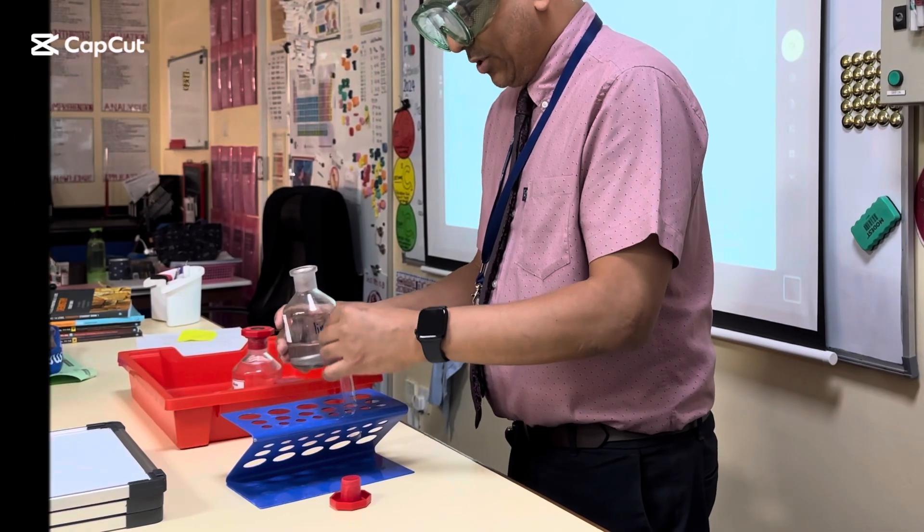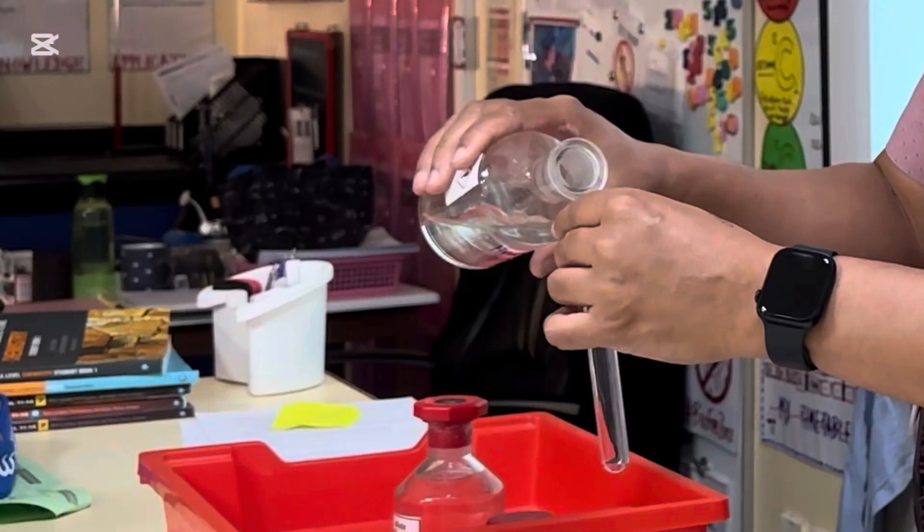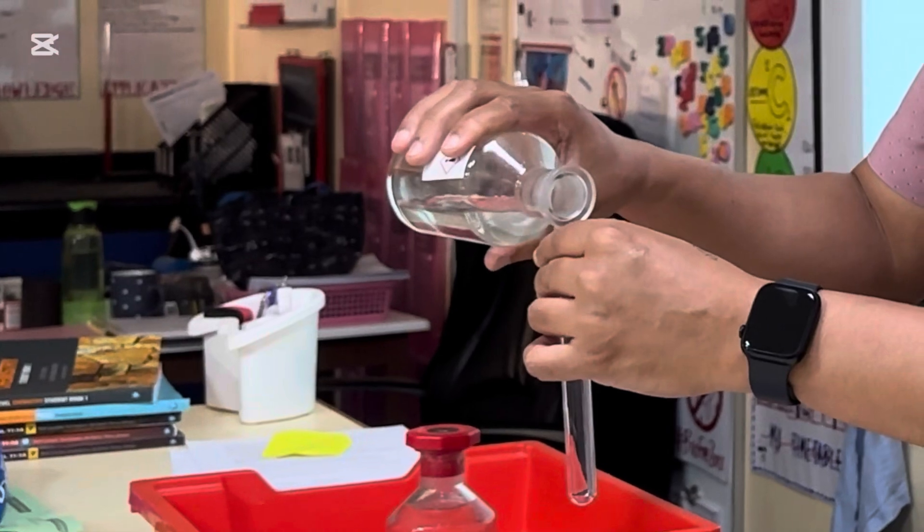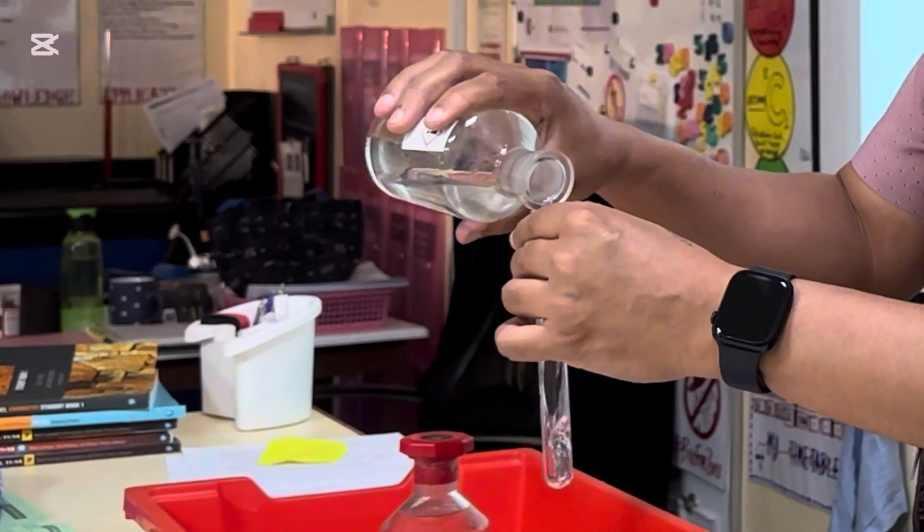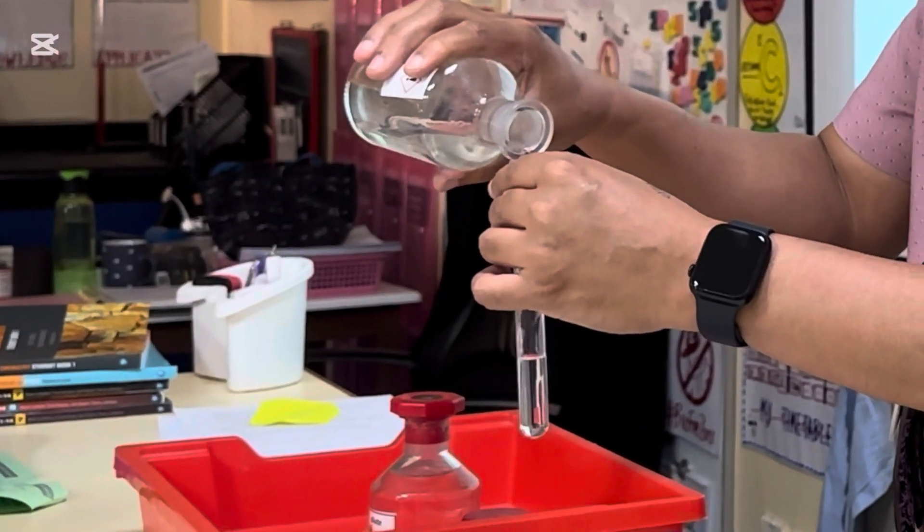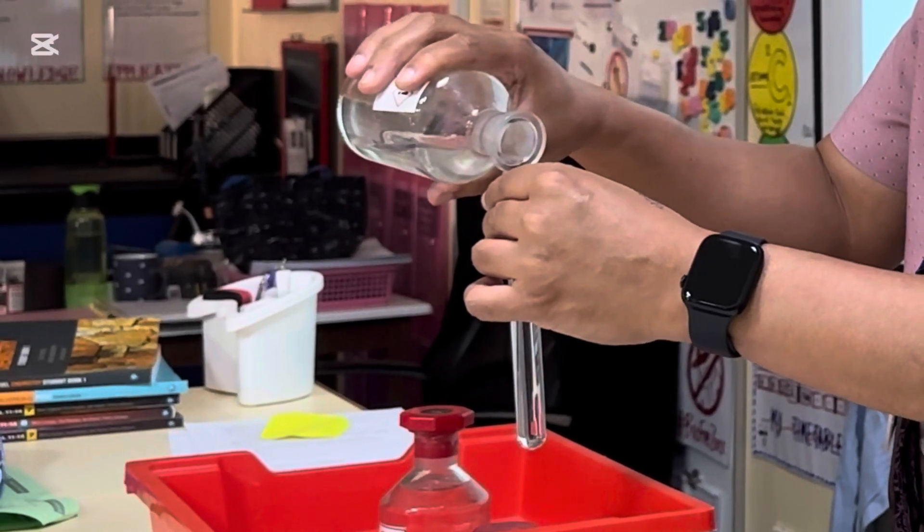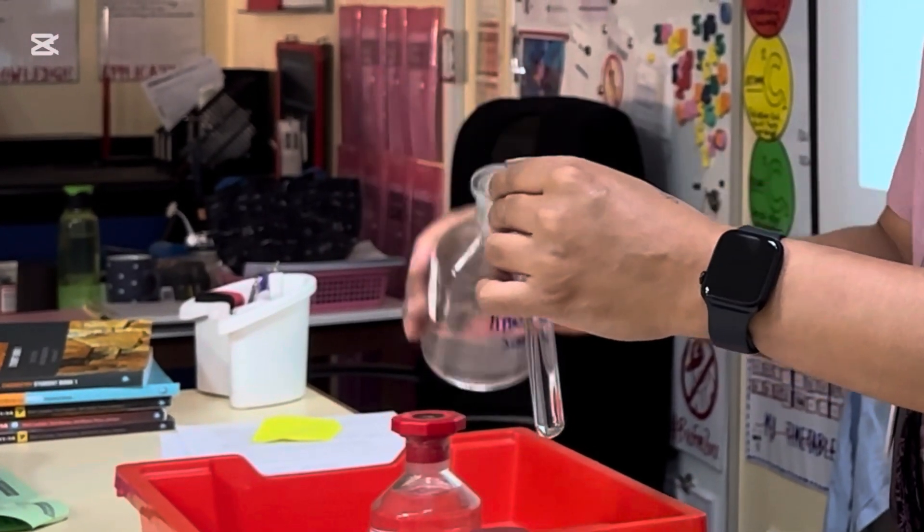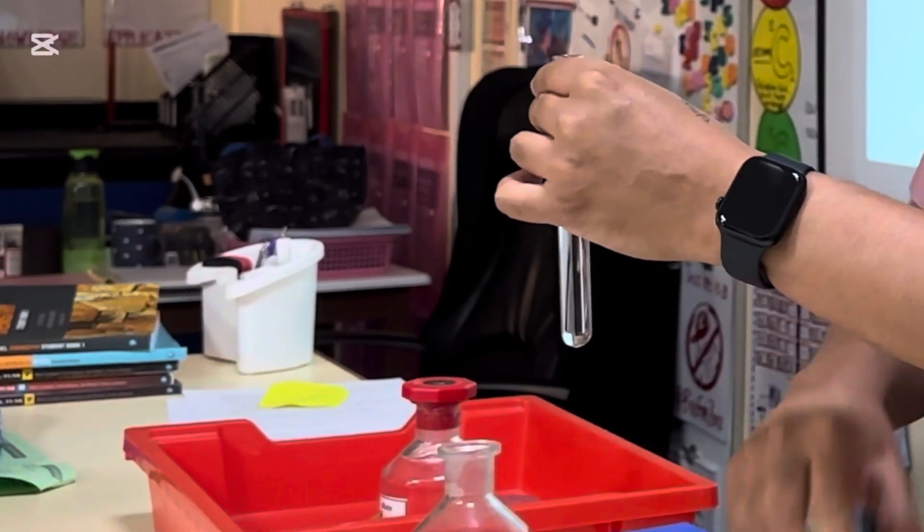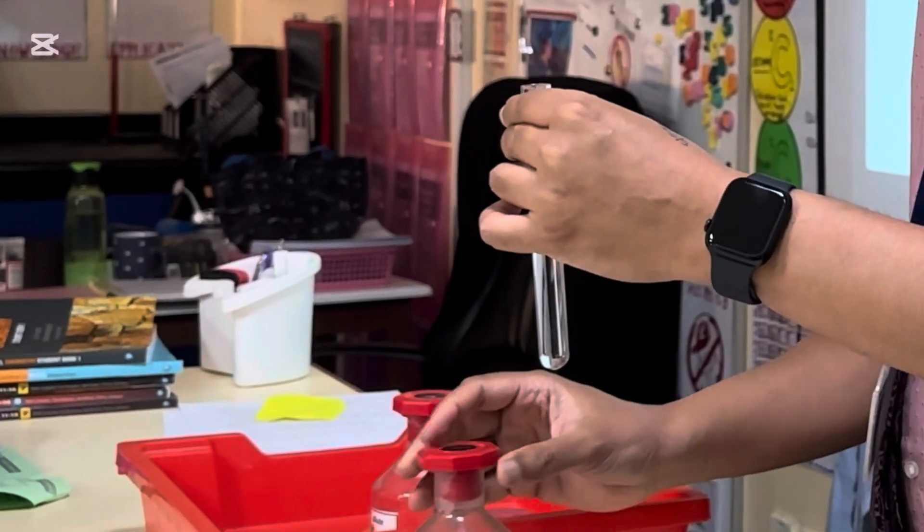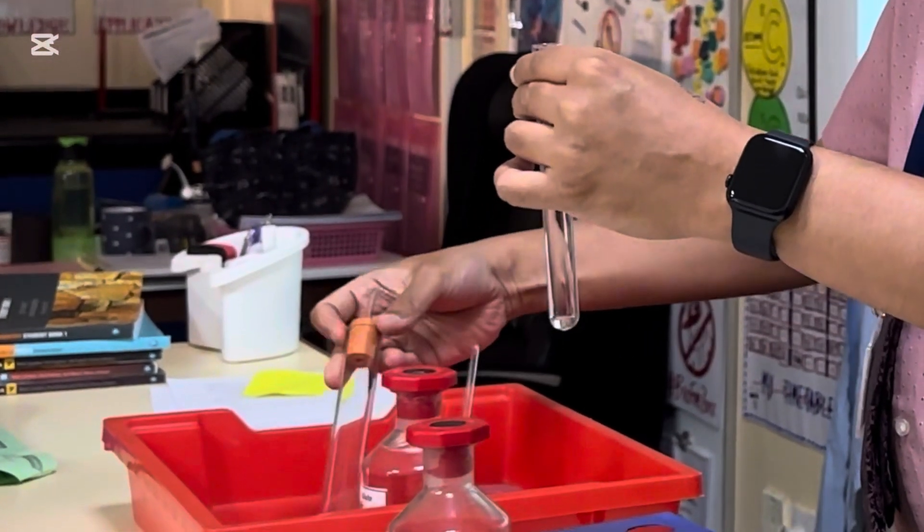So here we have some lime water. I'm just going to pour enough lime water into this test tube so that it will submerge the end of this tube.